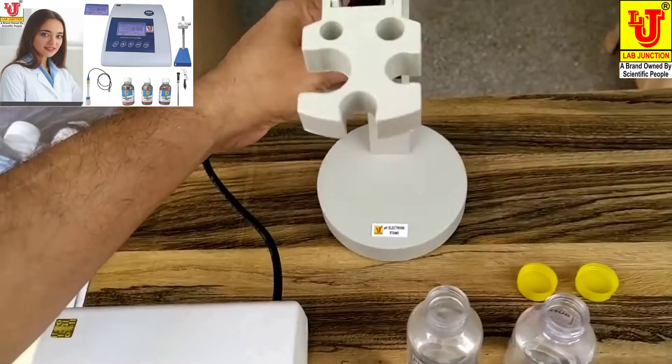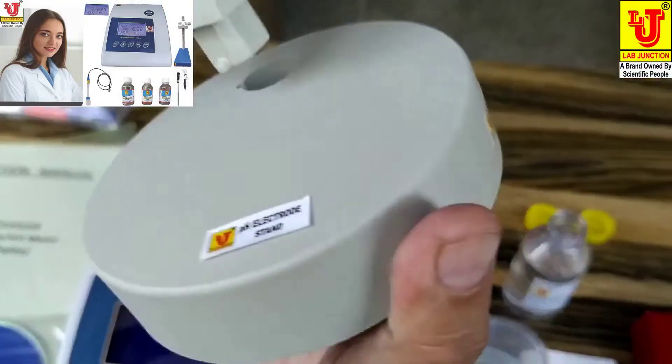This is the stand for pH meter. You can mount this very easily.